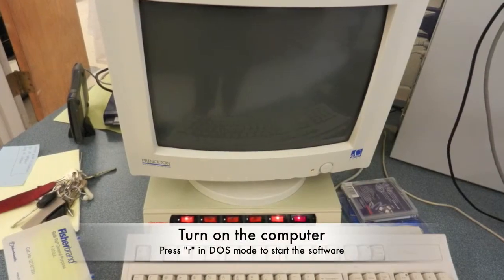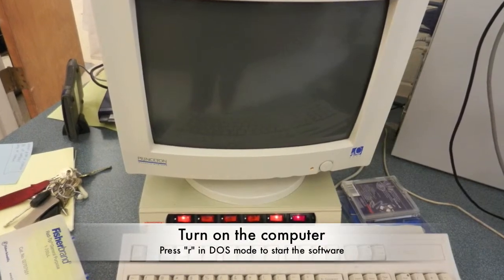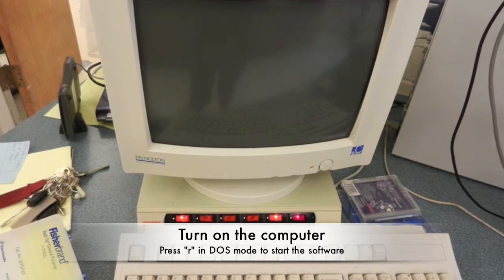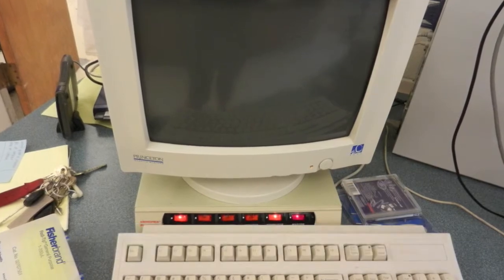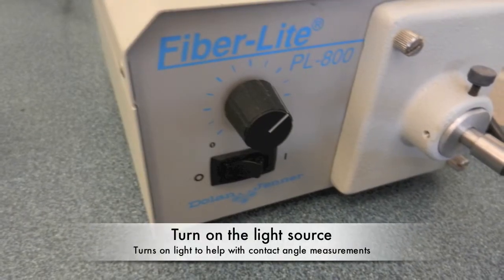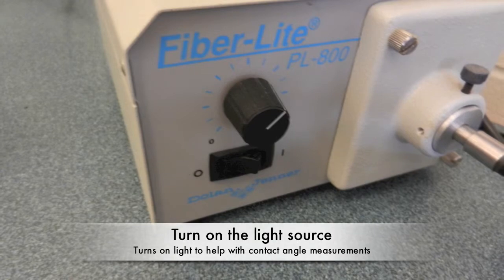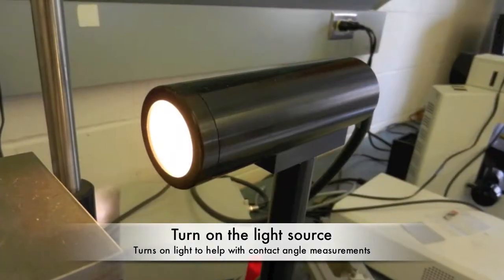Turn on the computer. When in the DOS mode before you enter Windows, hit R to open the software. Turn on the lamp source to turn on the light, which is needed for accurate contact angle measurements.